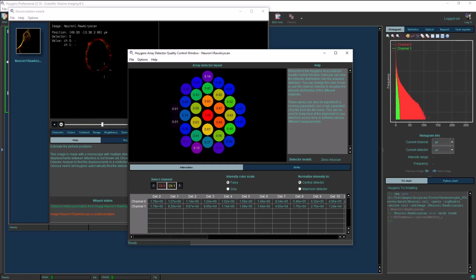You can export this information from the top menu bar by clicking File, Save Export, and Export Intensity Table. You can also export the visualization of the intensities in the color mode of your choosing from this same menu option by clicking Export Displayed Image.